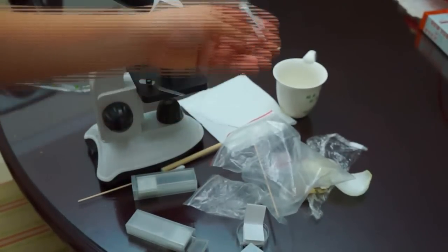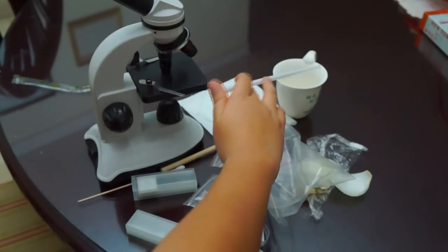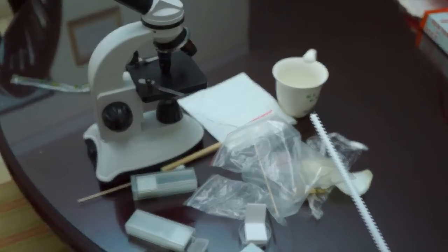Now, since I don't have a dropper, I'm going to use a straw to put some water on top of that epidermis that we're using. A dropper is always better, but in some cases, if you don't have any dropper, you can use a straw.